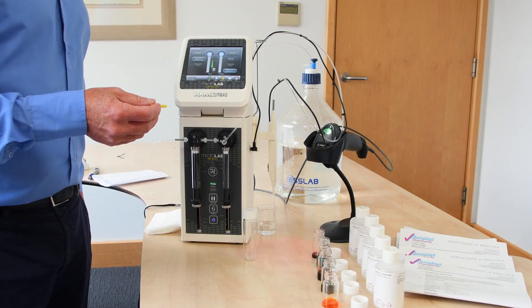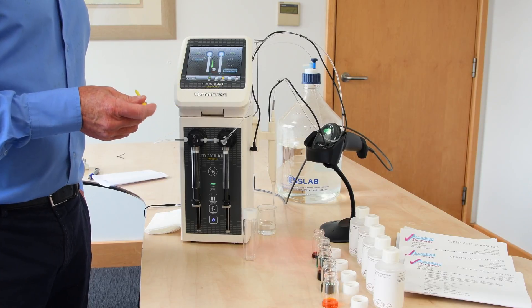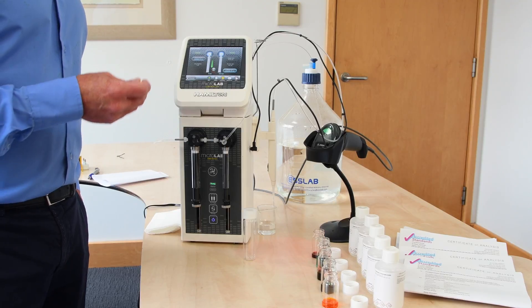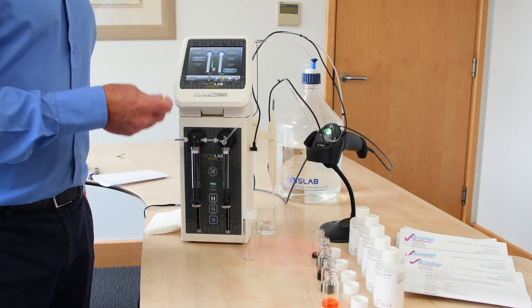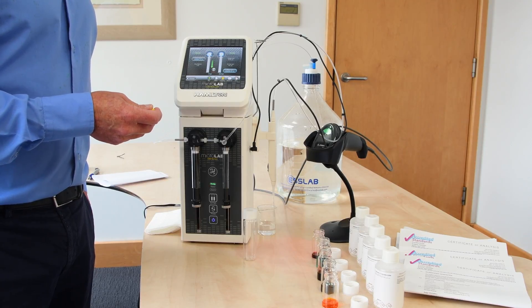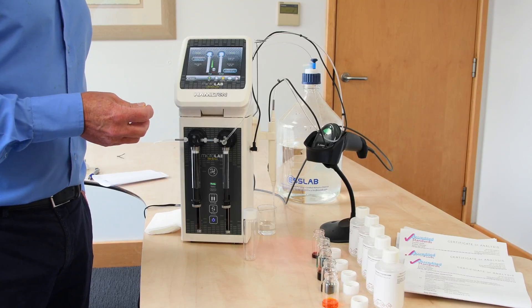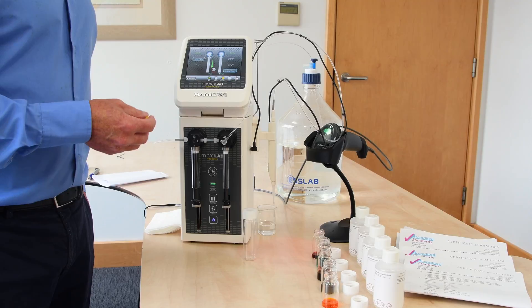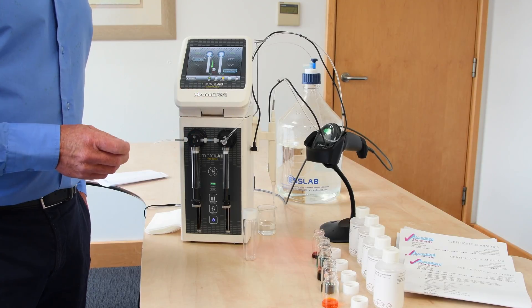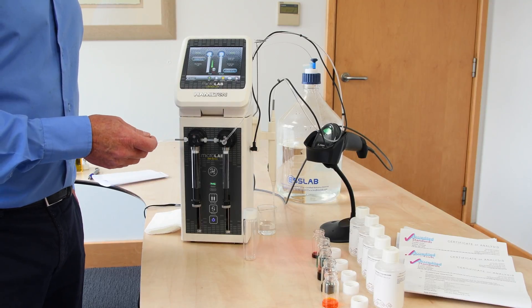We can improve on that further by saving the program into our custom folder, which allows us to add instructional text describing the steps the user needs to take into account. It follows the workflow for preparing the standard and also allows us to integrate other equipment with the Hamilton Microlab, including a barcode reader, bringing apparent traceability benefits.